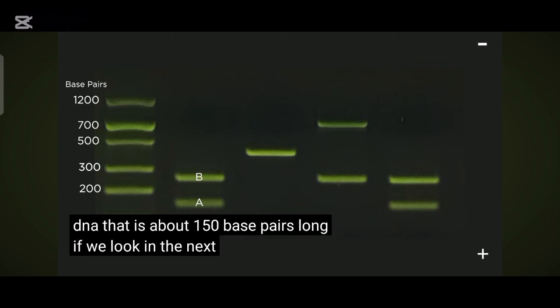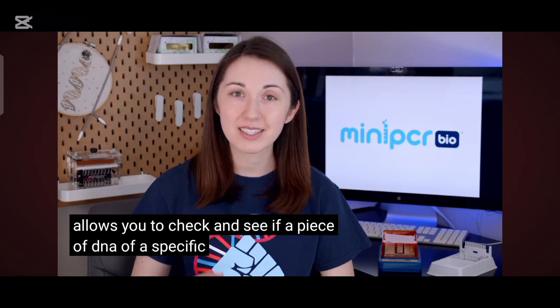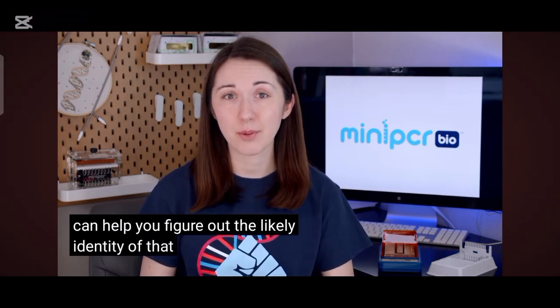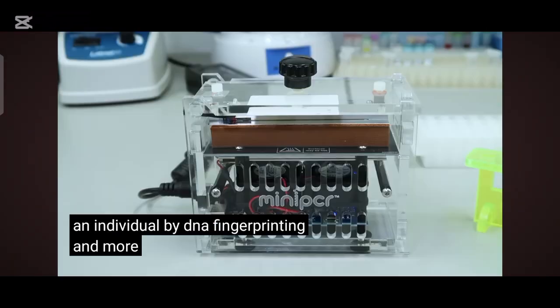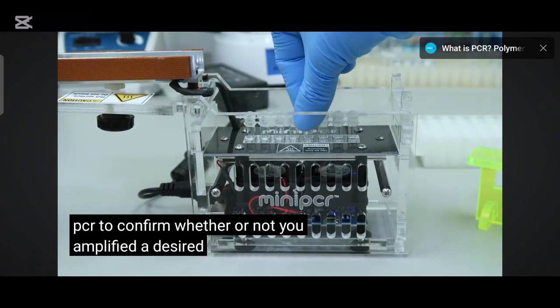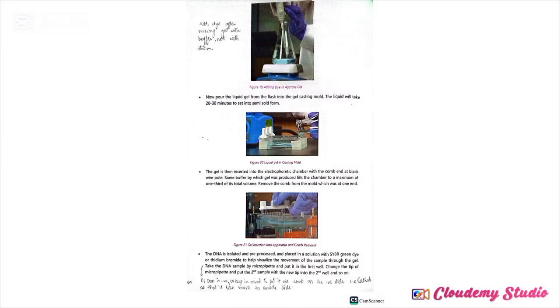If we look in the next lane, we can see one band that is about 400 base pairs long. DNA electrophoresis allows you to check if a piece of DNA of a specific size is present in your sample. This can help you figure out the likely identity of that piece of DNA, helping to confirm an infection, identify an individual by DNA fingerprinting, and more. It is especially useful after PCR to confirm whether or not you amplified a desired piece of DNA. So that was all about the procedure of this practical. If you have any questions, you can ask in the comments. Allah Hafiz.